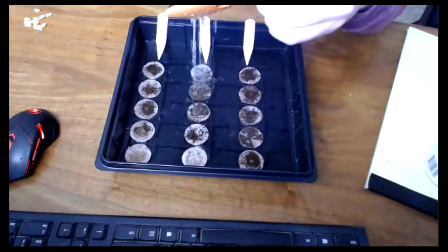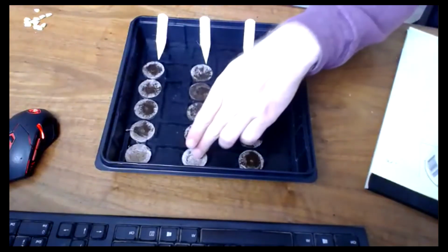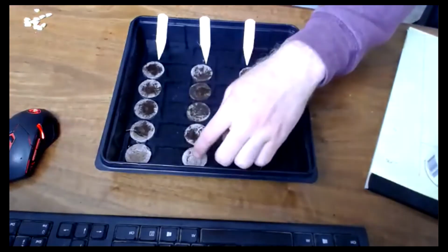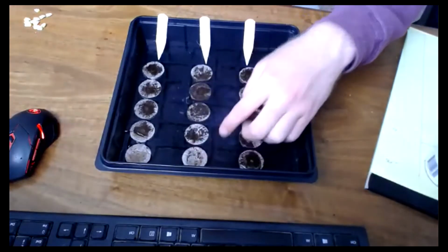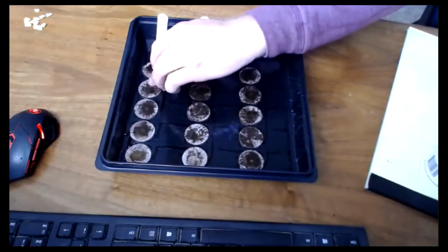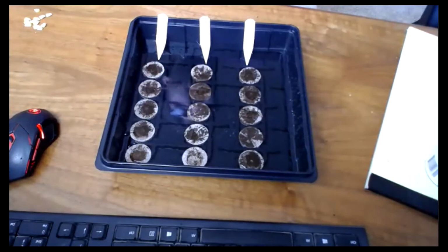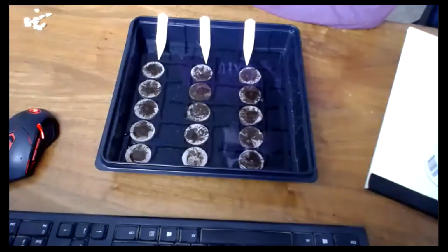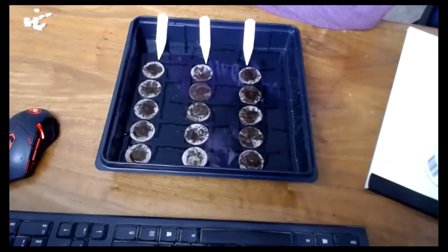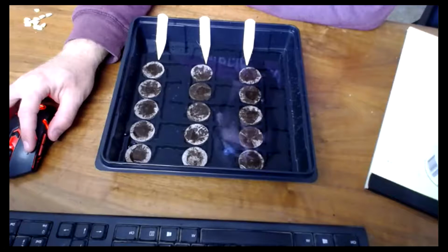You can use just regular soil media if that's what you've got at home. You can invest in these wafers. I'm a pretty big fan of these wafers, or whatever works for you. At the end of the day, you'll want to figure out the best way to get this experiment to complete on its own. So I'm going to pause the recording, and we will pick it up once these have expanded.